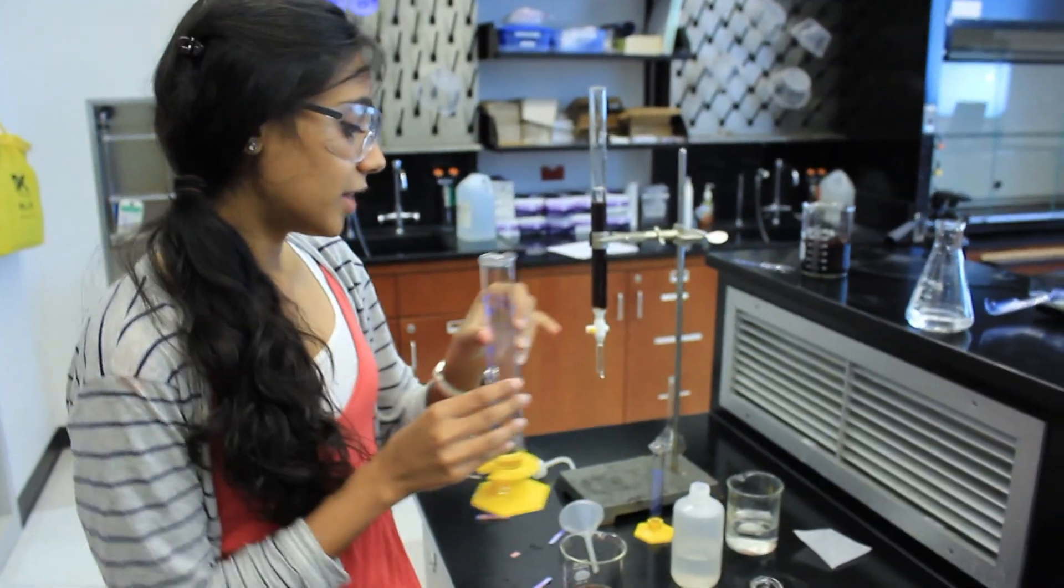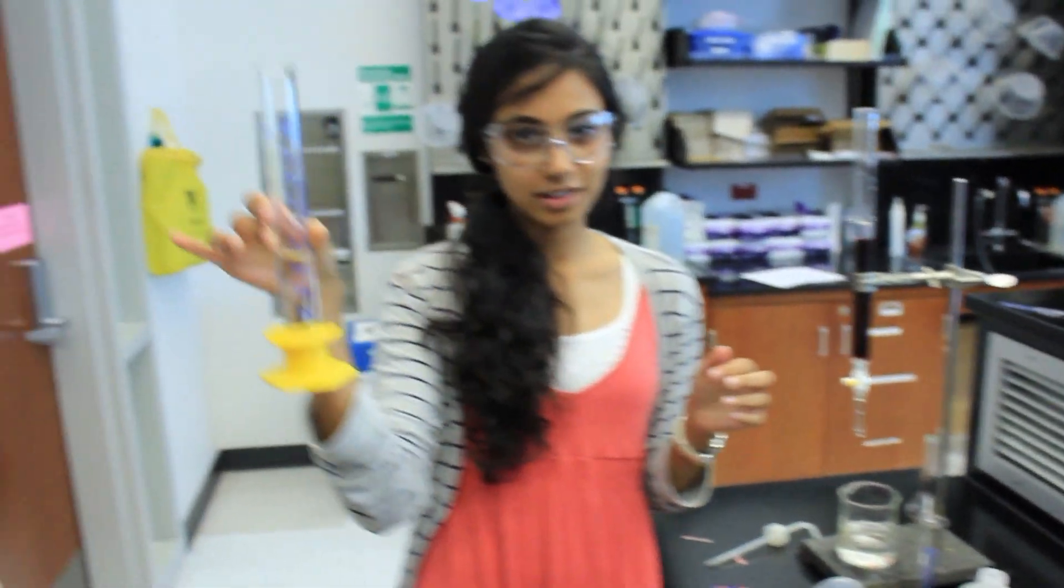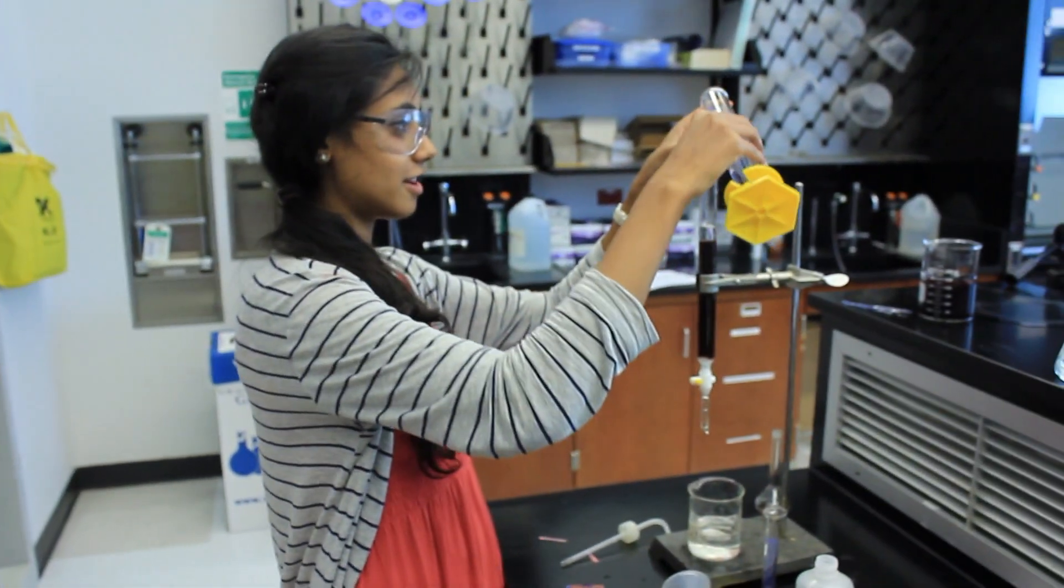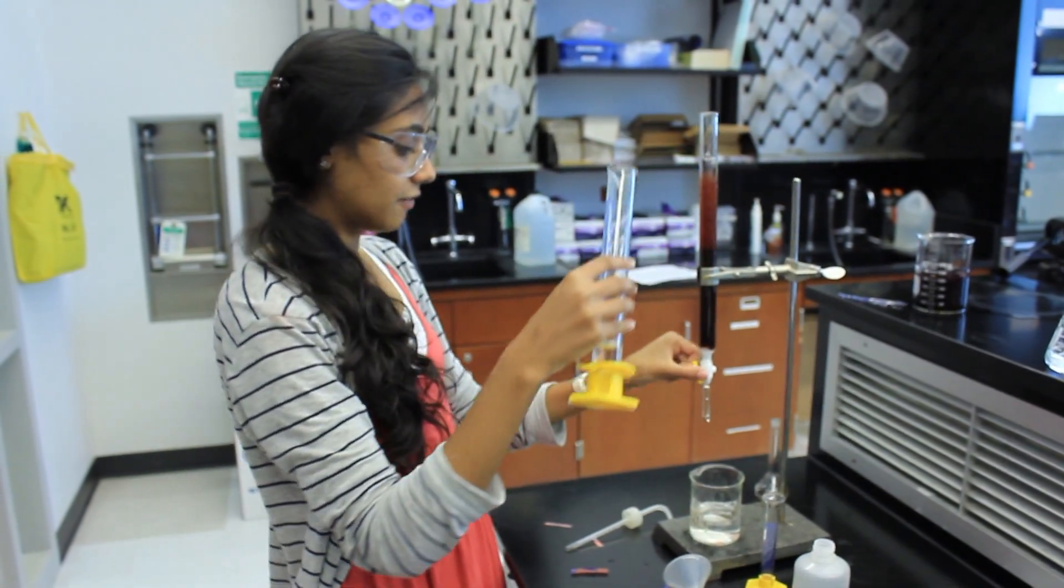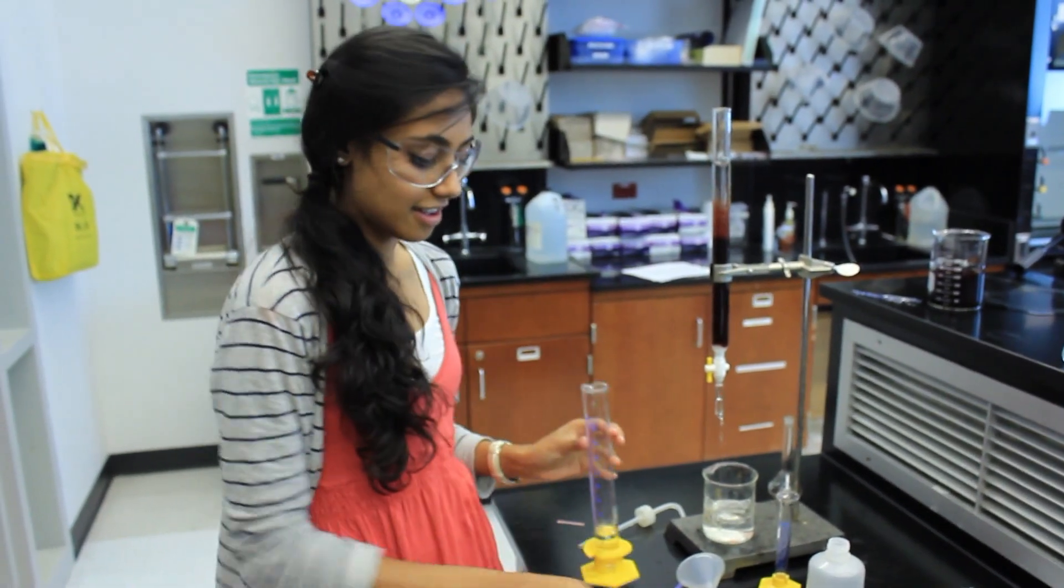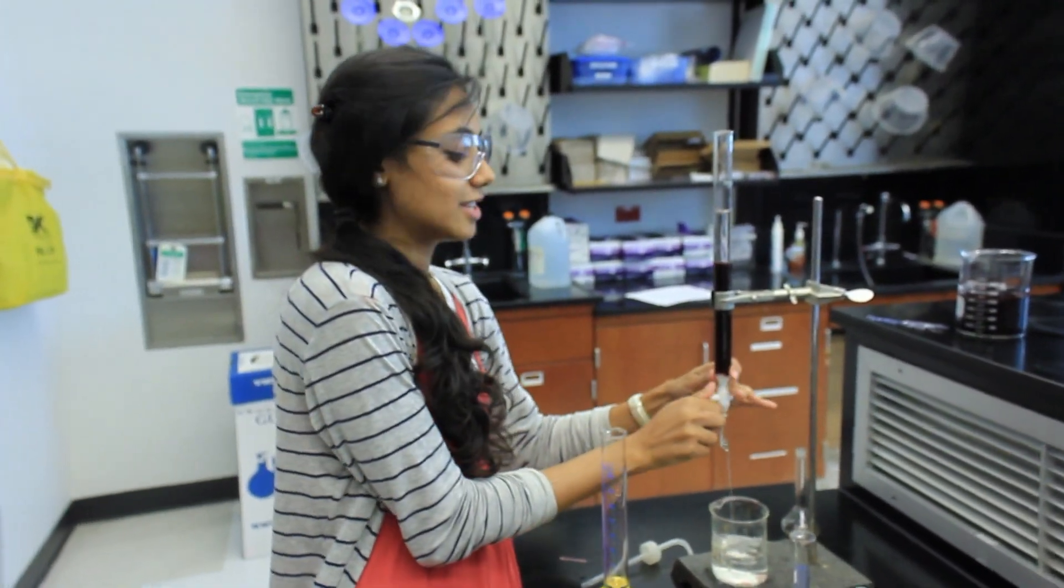To regenerate your acidic resin slurry, take 50 milliliters of HCl and pour it right on top of your slurry. Let it flow through until it turns acidic again. When it turns acidic, you're ready for your REN2. Again, you just take that to be titrated with your NaOH.